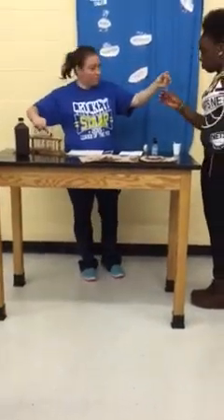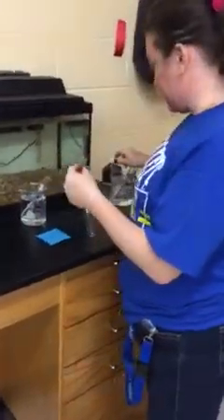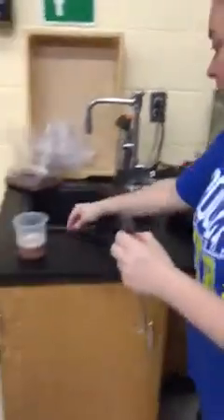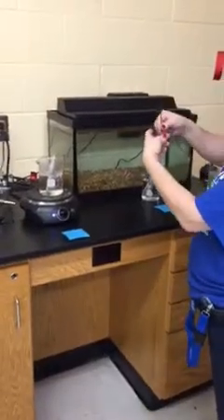This one we're going to place into a hot water bath right over here. And then in our lukewarm water bath we're going to add the two with the peroxide, and then each one of these is going to have to have liver in it. There's the warm and then into the cold. Now those have got to sit for about three to five minutes or so.